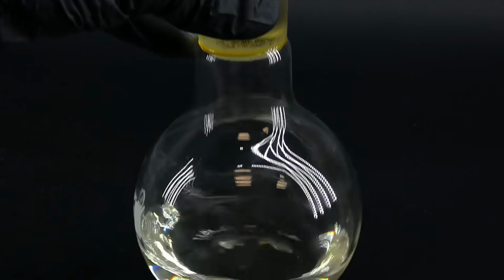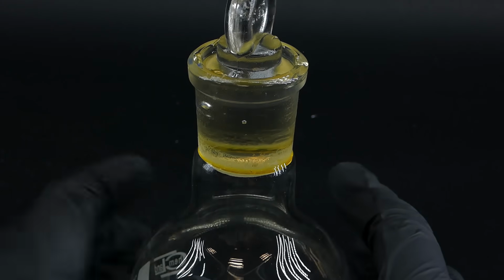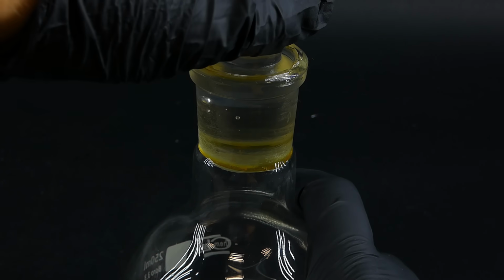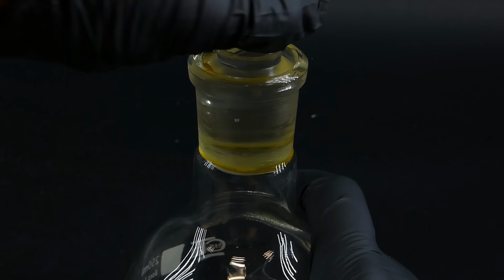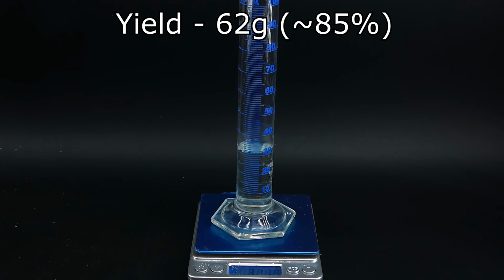Anyway, when I came back to the glacial acetic acid flask, it looked like the acid managed to react with a small amount of the grease, which wasn't a good sign, especially now when I had to weigh it and determine its concentration. It turns out that I managed to make 62 grams, or about 60 milliliters of really nice and clear glacial acetic acid. It has a concentration of about 95% based on the purity of sulfuric acid used to make it. The exact concentration of the acetic acid is quite hard to accurately calculate with my tools.